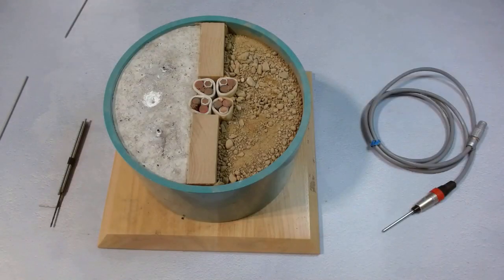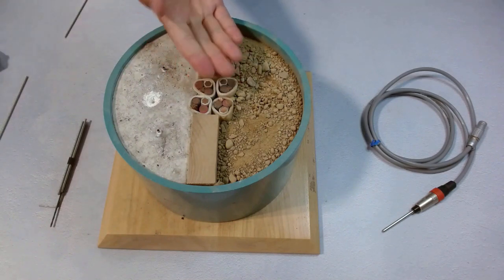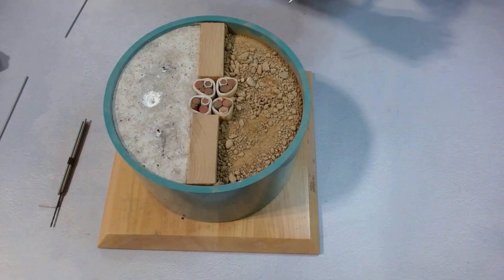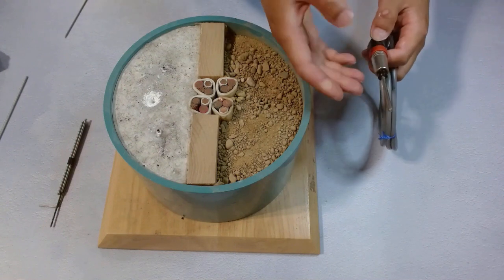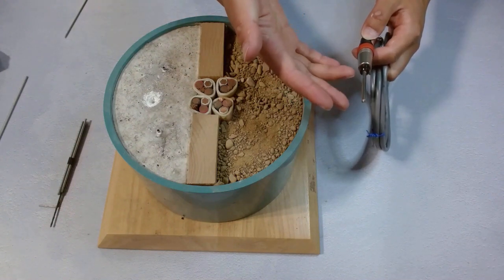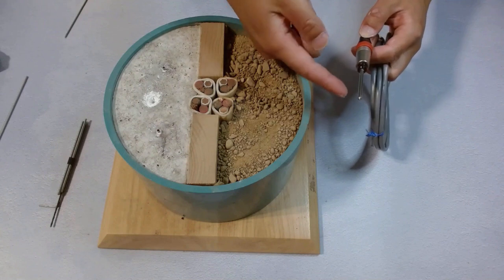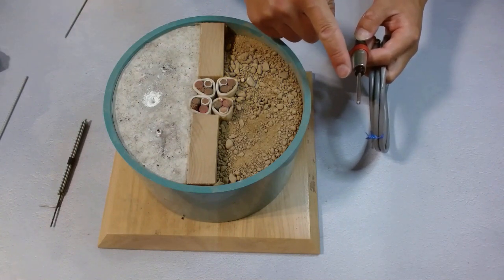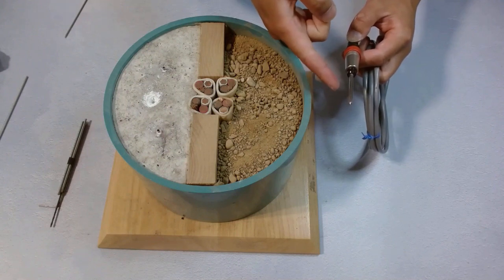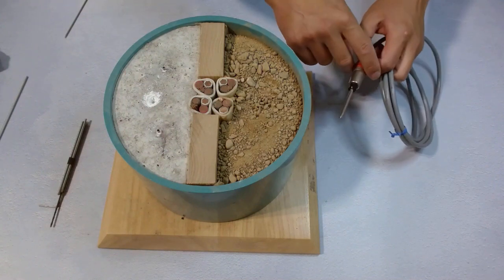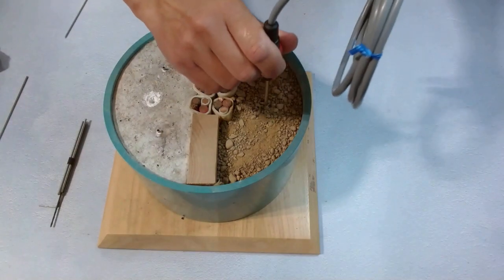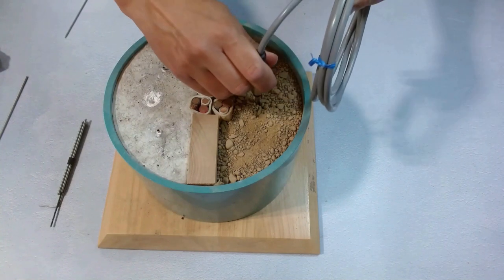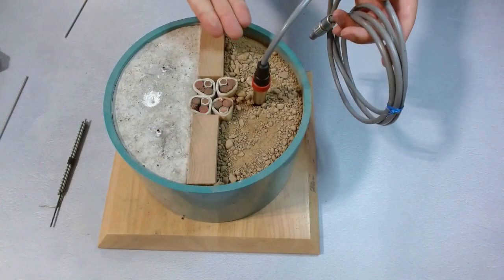Another way of measuring solid earth samples is using TRS-50 rock needles. This is a TRS-50 rock needle. It is 50 millimeters long and 4 millimeters in diameter. So it is much thicker and stronger. It follows another standard but is as accurate and effective. We can easily just push it in the earth. It's going pretty easily and goes all the way in.